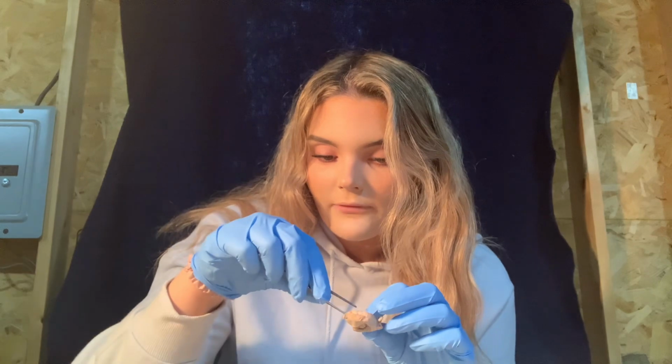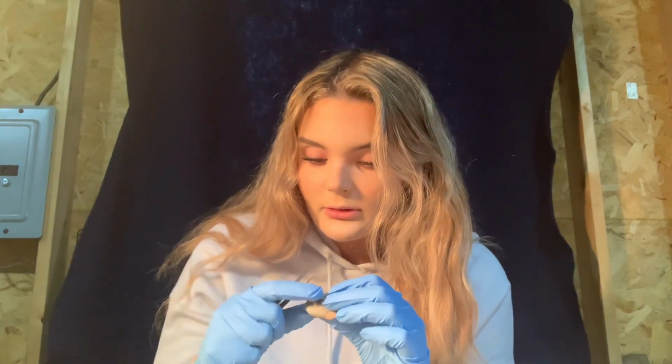Then we have cones. The cones are the receptor cells of the retina, and they're in here, behind the lens, and they are responsible for perceiving color. Then we have the cornea, which is a transparent covering that allows light to enter the eye. We took the cornea off. The cornea is like in here. It was what covered here. We took the cornea out. It was a little transparent covering.